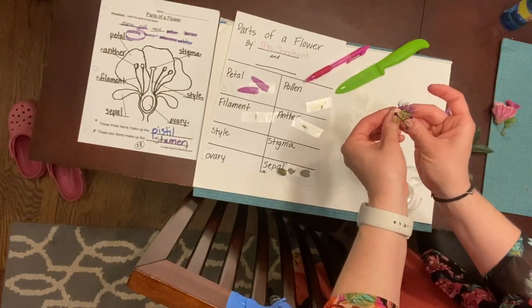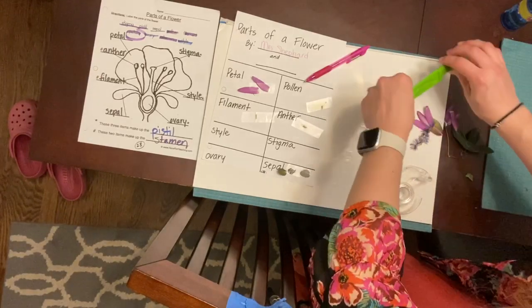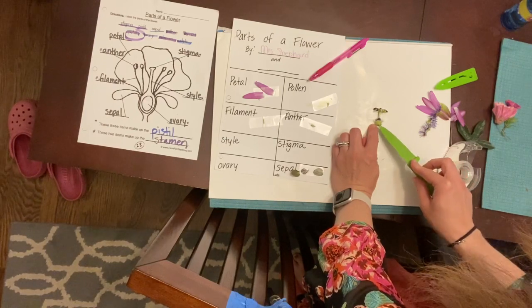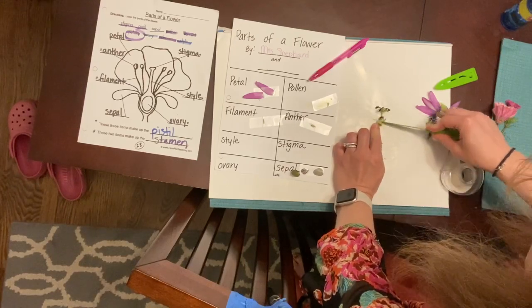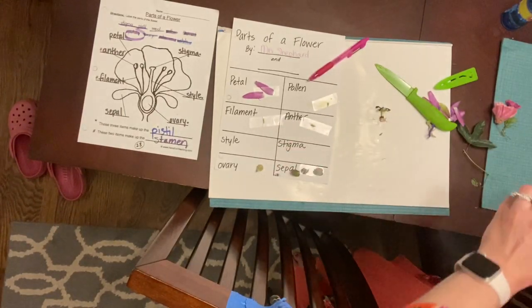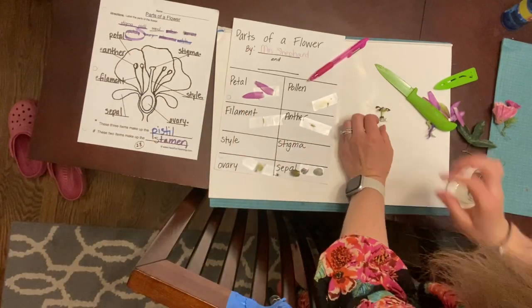And I'm just gonna pull off all these little beautiful purple parts because I'm not sure what fundamental part they play in this. And I'm gonna use my knife for this. So I have this big area at the bottom here, and this is where the stem was coming out. So I'm gonna cut this off right here because this is the ovary on the inside. This is the part where the eggs are waiting for the pollen to come down the style. And that is the part that's going to then grow and turn into the seeds and the fruit.